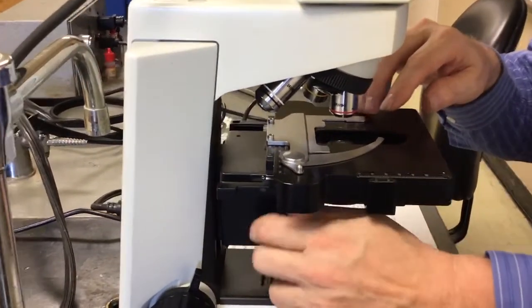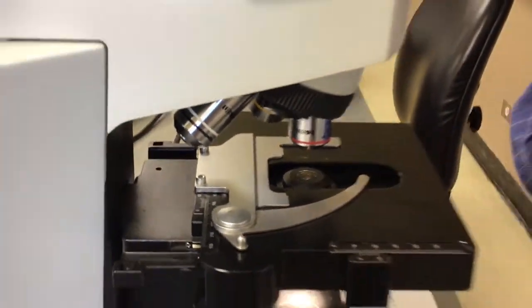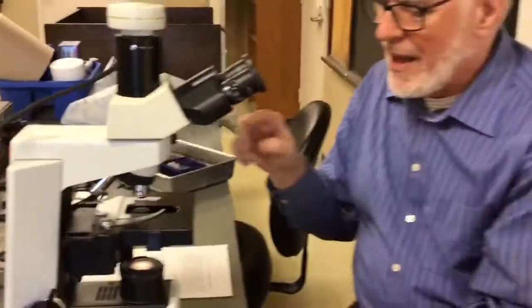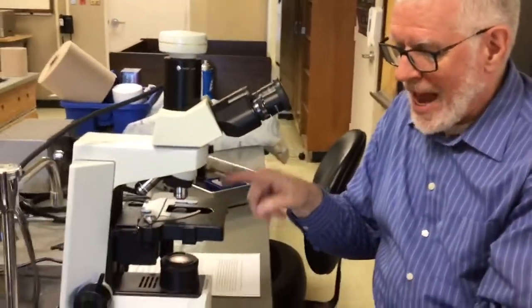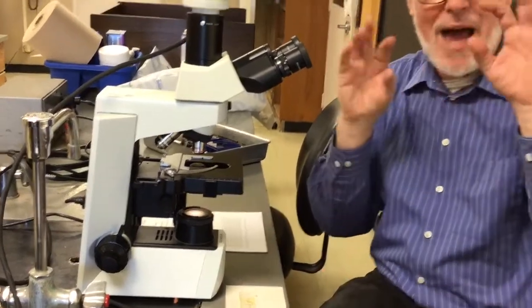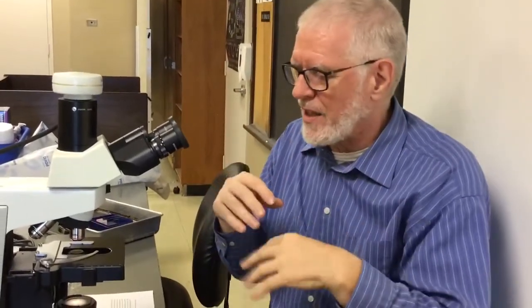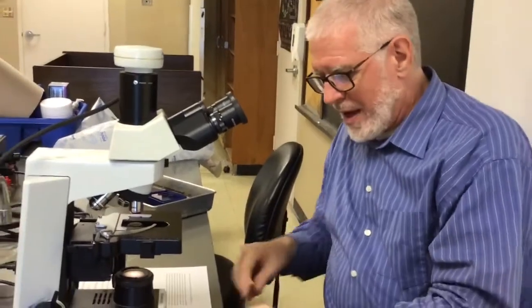It's got to be up really close to what you're looking at. If it gets in just the wrong place though, it will send you a magnified image of the frosting on the light bulb. And so the background will get all speckly. And so if you have that, you just move the lens a little tiny bit so that it's focused on the light and not on the surface of the light, and that's fine.